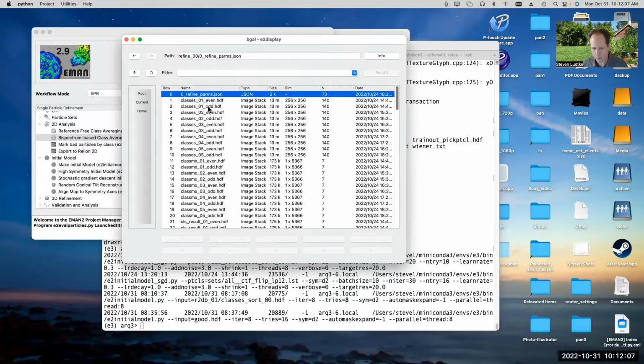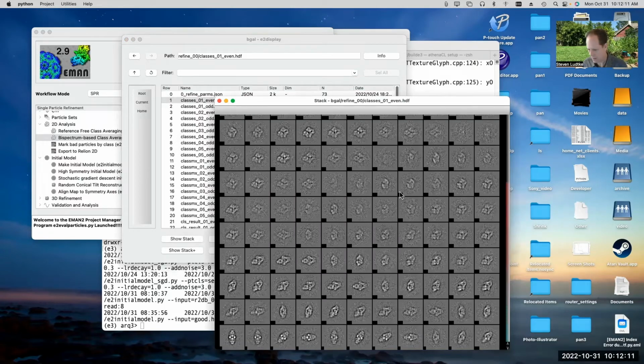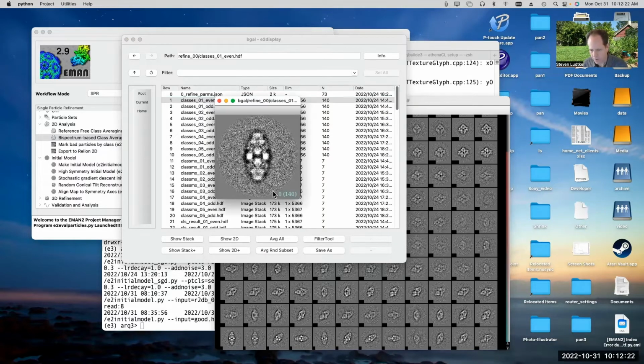All right, so we can look at the class averages and see how they look. These progress from the view along the z-axis here, and then they spin around gradually. Actually, if I open this in the 2D view and use my mouse, you can see how the class averages are generated. You can see how it's rotating as I go through the class averages sequentially by holding the down arrow down.